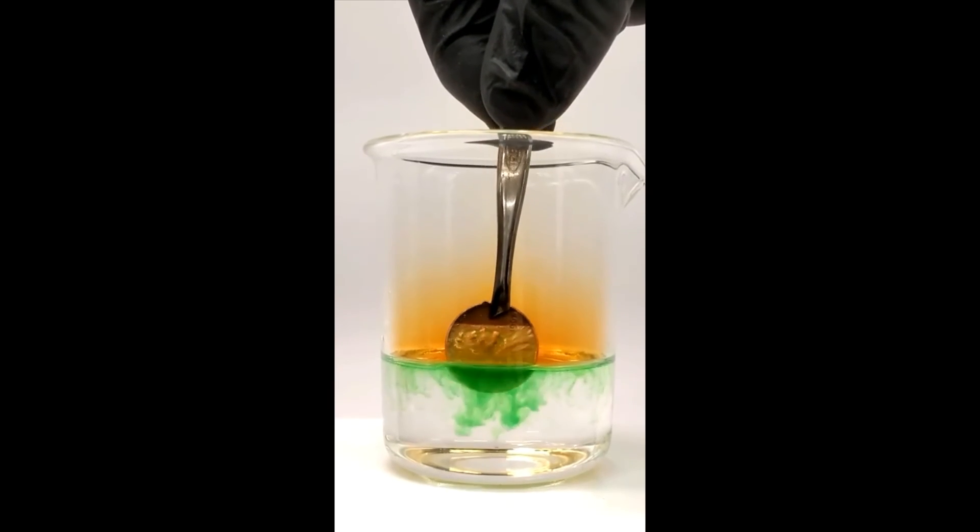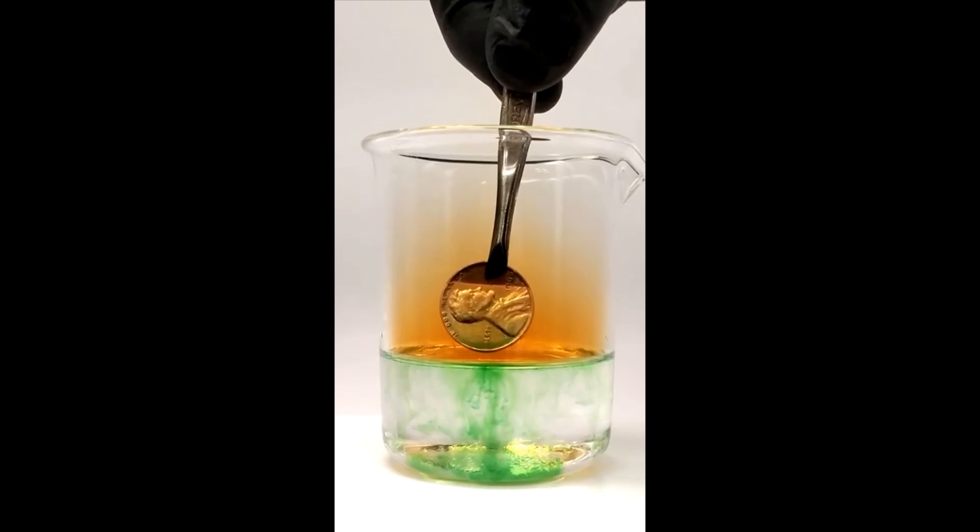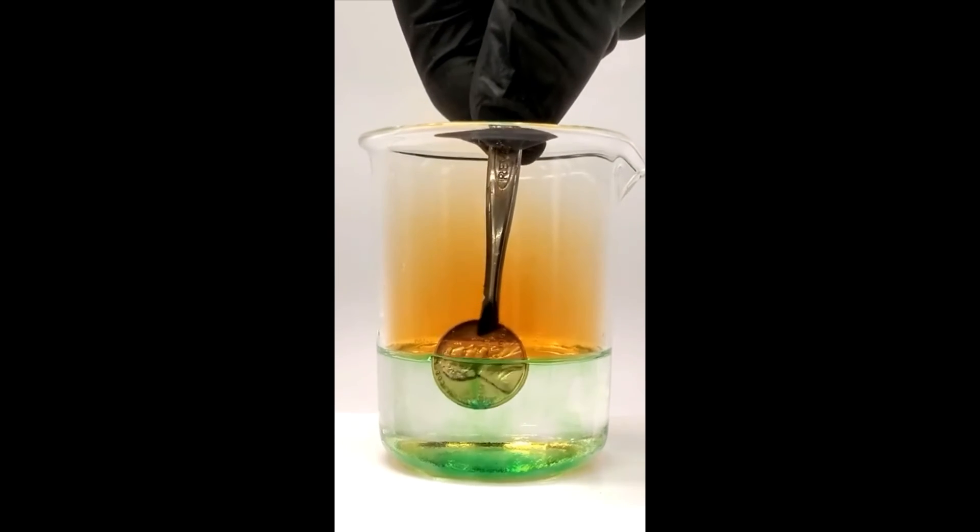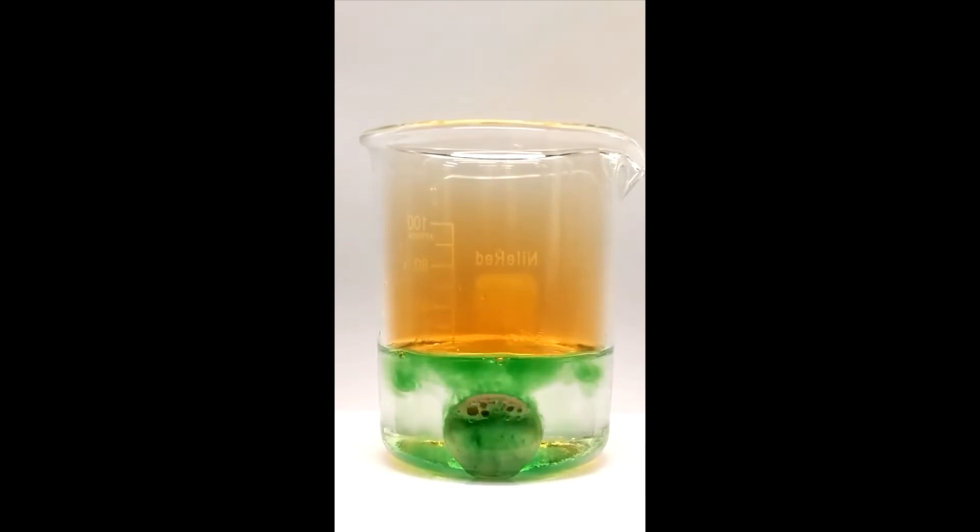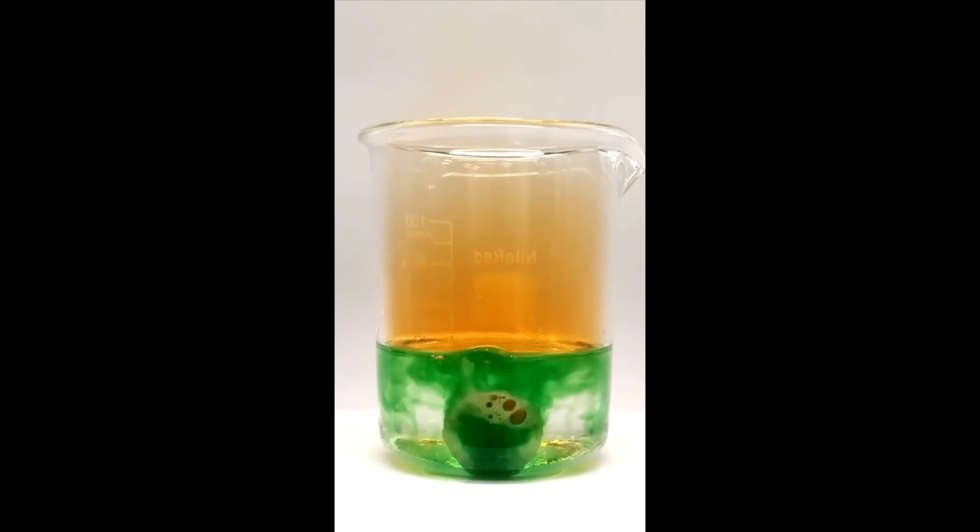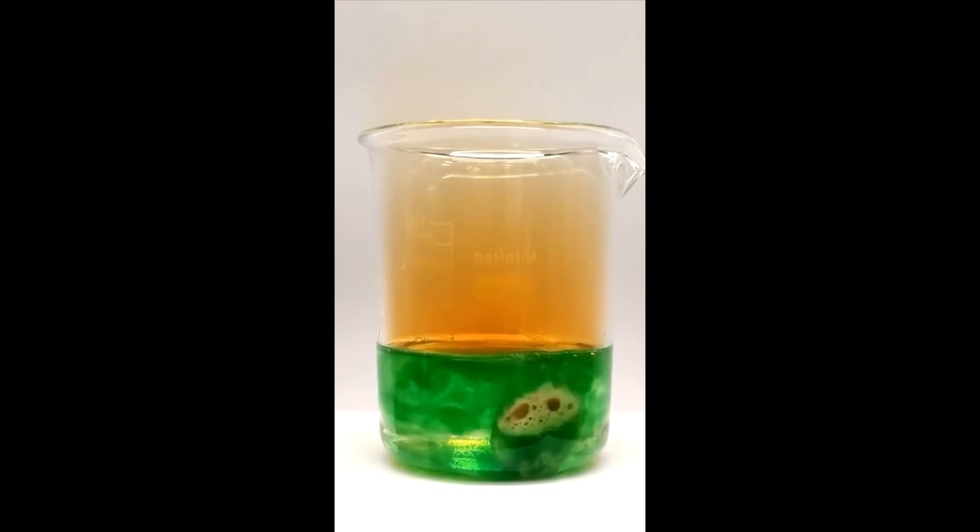It also kind of cleans it and makes it shiny again. As it eats it, it starts pouring off nitrogen dioxide gas, which is something that you really don't want to breathe in.